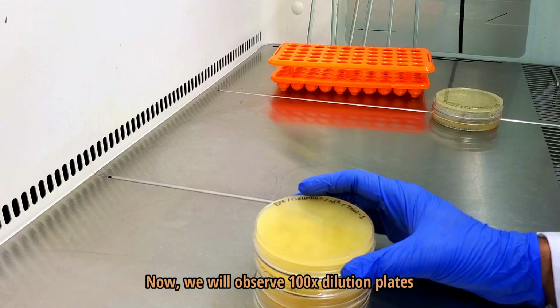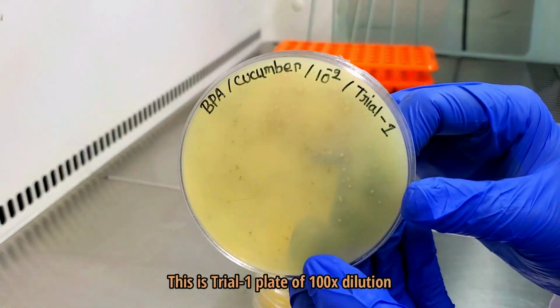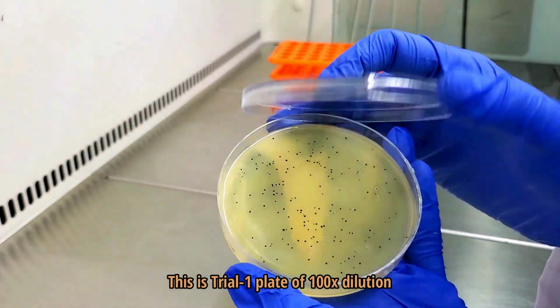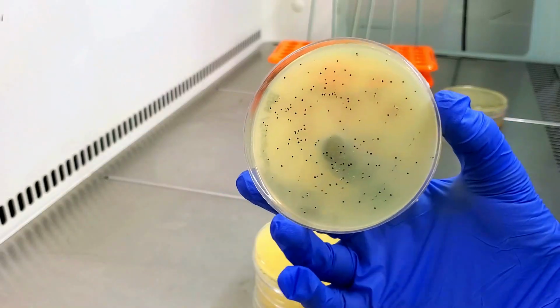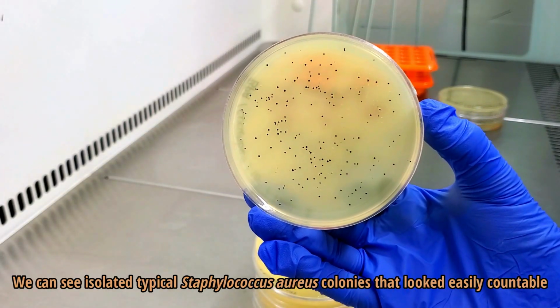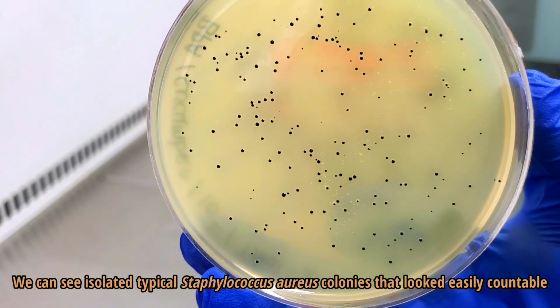Now we will observe 100 times dilution plates. This is trial 1 plate. We can see isolated typical Staphylococcus aureus colonies that looked easily countable.